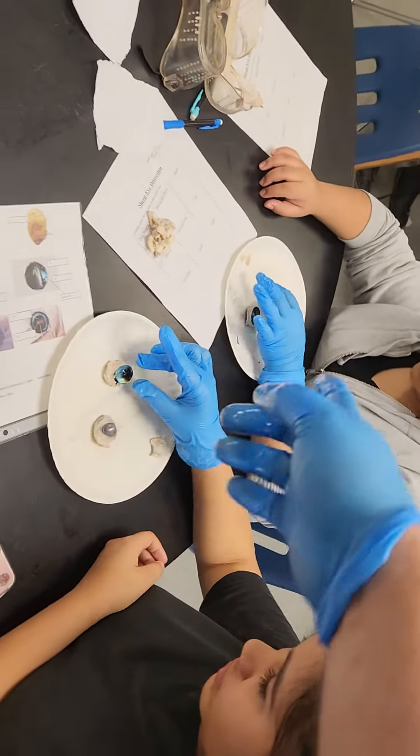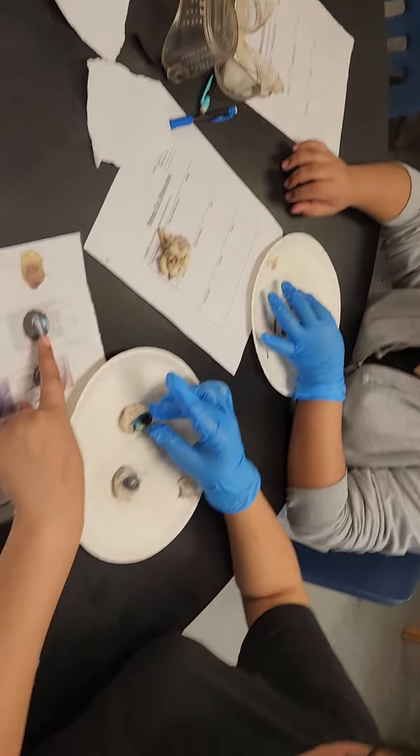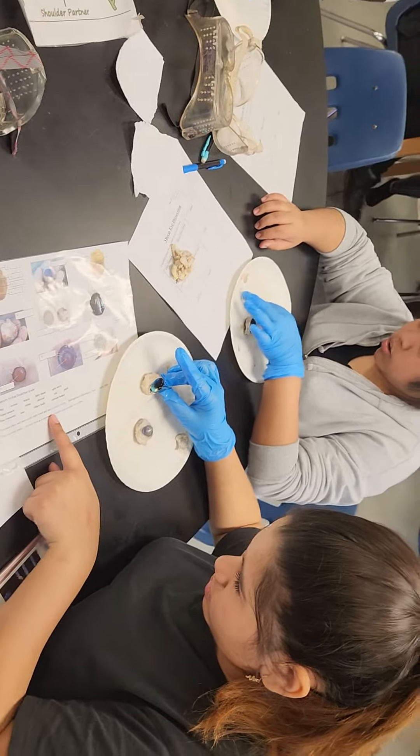Just the inside of the eye? It's on top of the retina though. This looks so cool, but like... so which part is that? That's the part that absorbs the color.